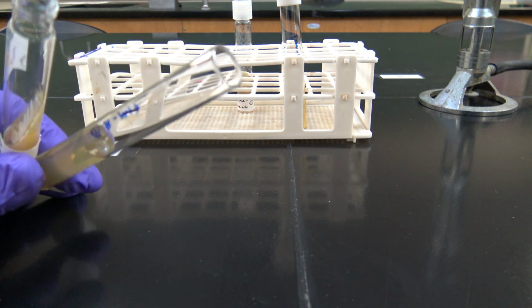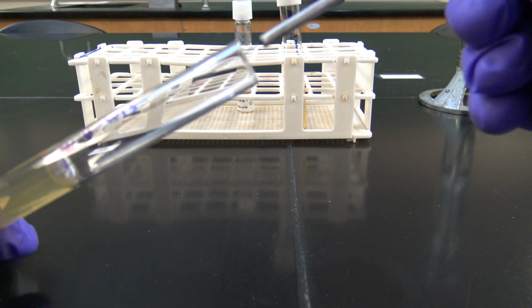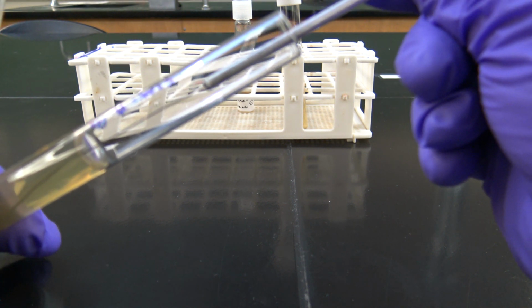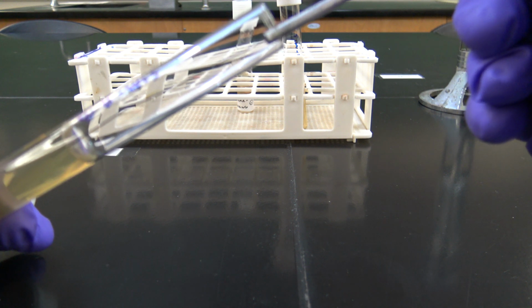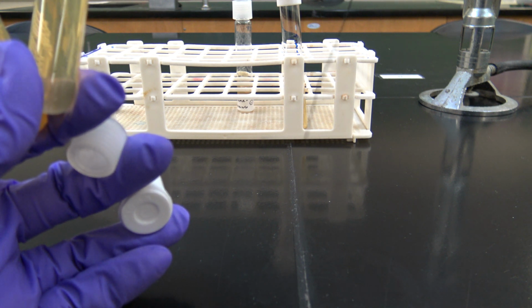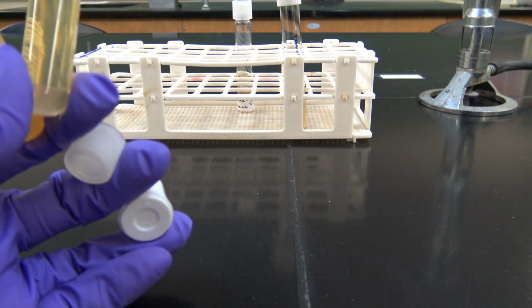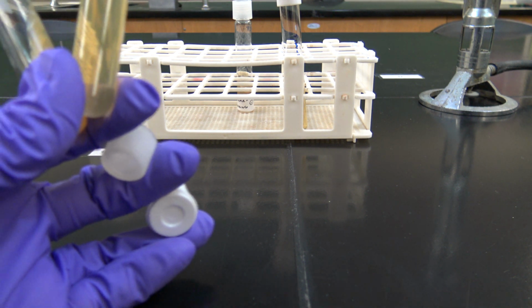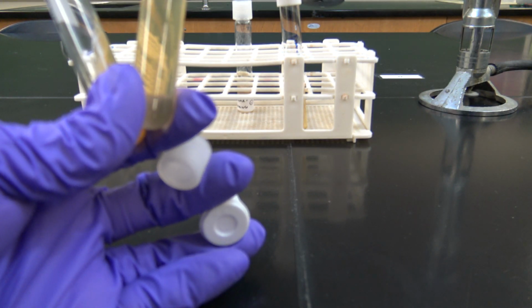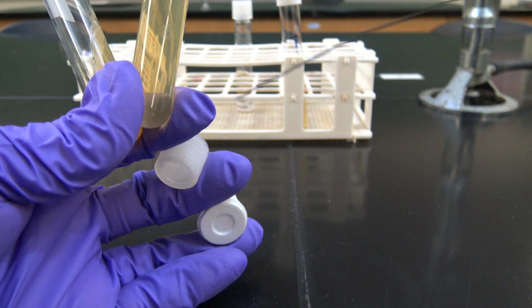And now I'm going to go into the middle of the tube, and as gently as I can press down into the center and then pull straight up. Once you're in there, you don't want to move around too much because you don't want to make a big tear in the media, because you want to see a midline to your inoculation so you can see how far away from the midline the cells are motile. So if you go back and forth too much, it'll be hard to tell if your cells are motile or not.